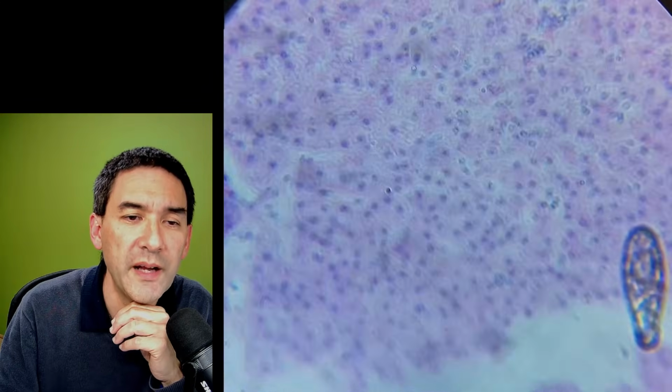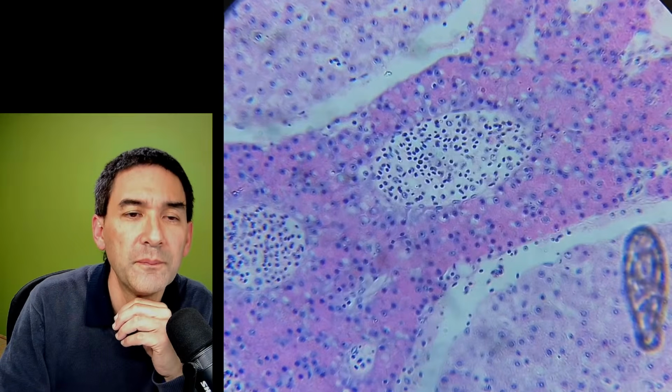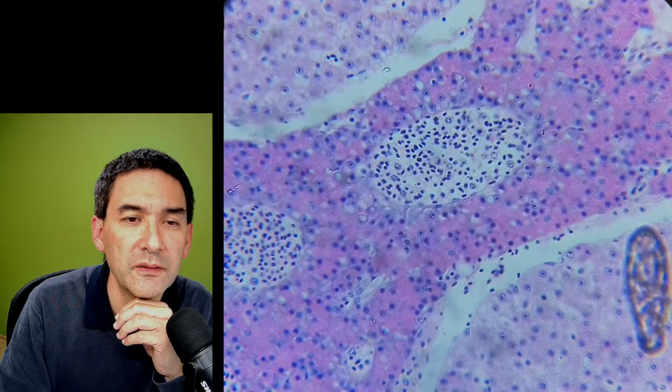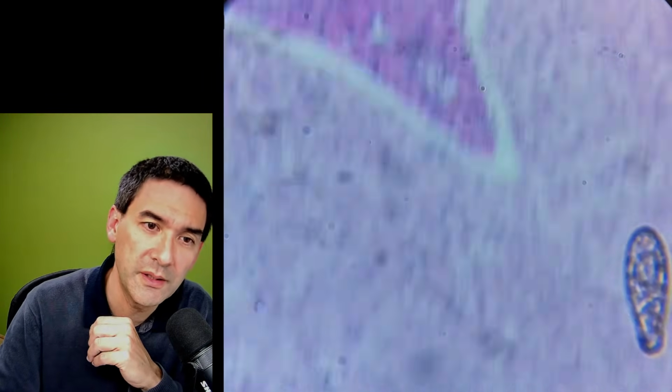Again, this is without condenser, without anything like that. So still quite nice.